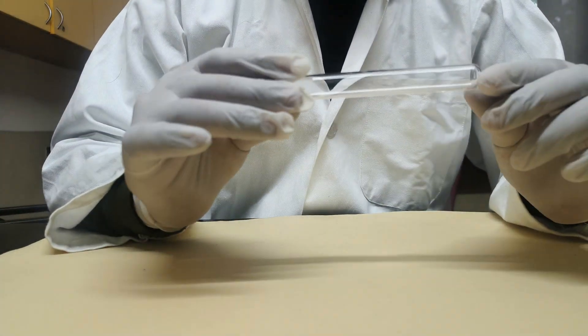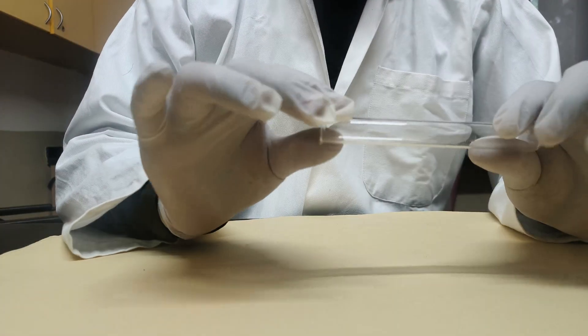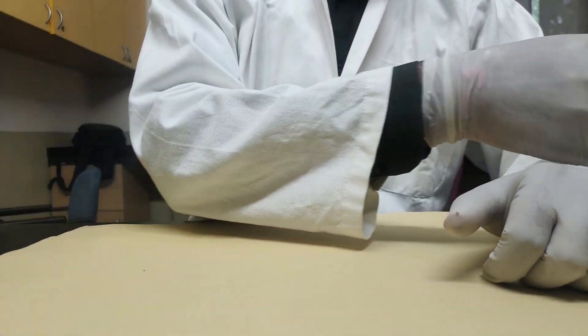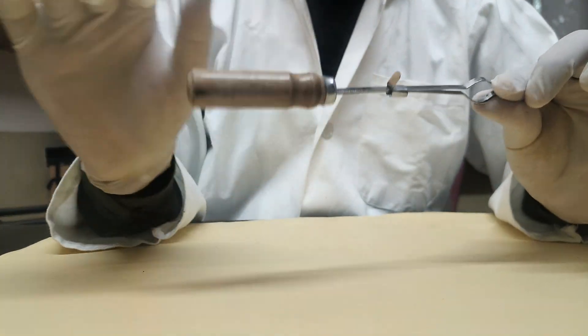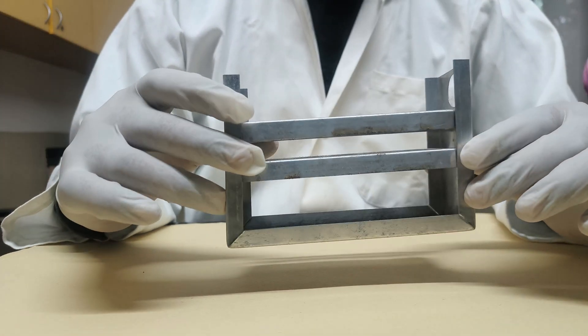Next is the test tube. It is used to hold small quantities of chemicals and to heat small liquids in the lab. Next is the test tube holder. It is used to hold the test tube while heating and to keep our hand safe during the heating process.